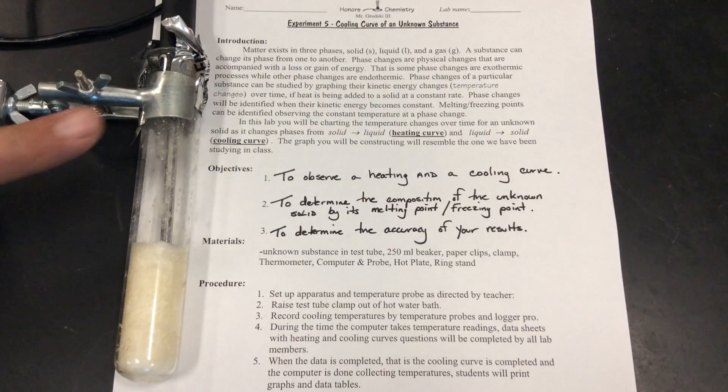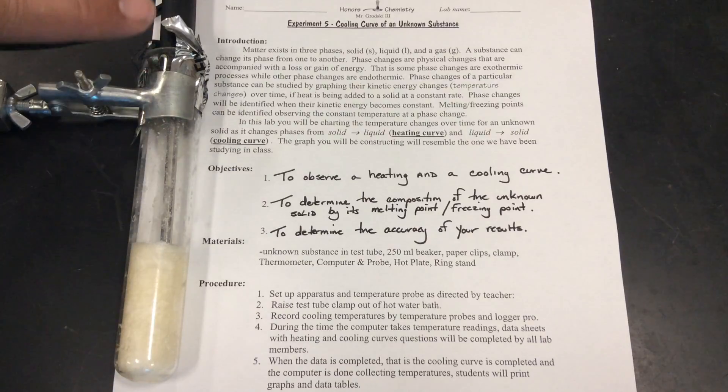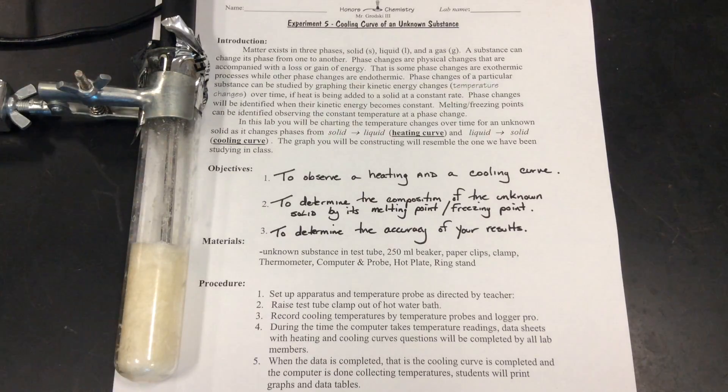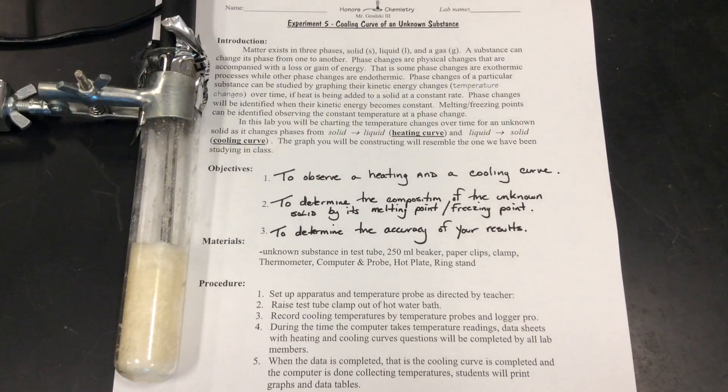If you notice in my test tube, I have a temperature probe which is stuck embedded into the solid connected via USB into a computer using a computer program, LoggerPro. We're going to graph in real time the changes in temperature of our solid as we heat it and as we cool it.